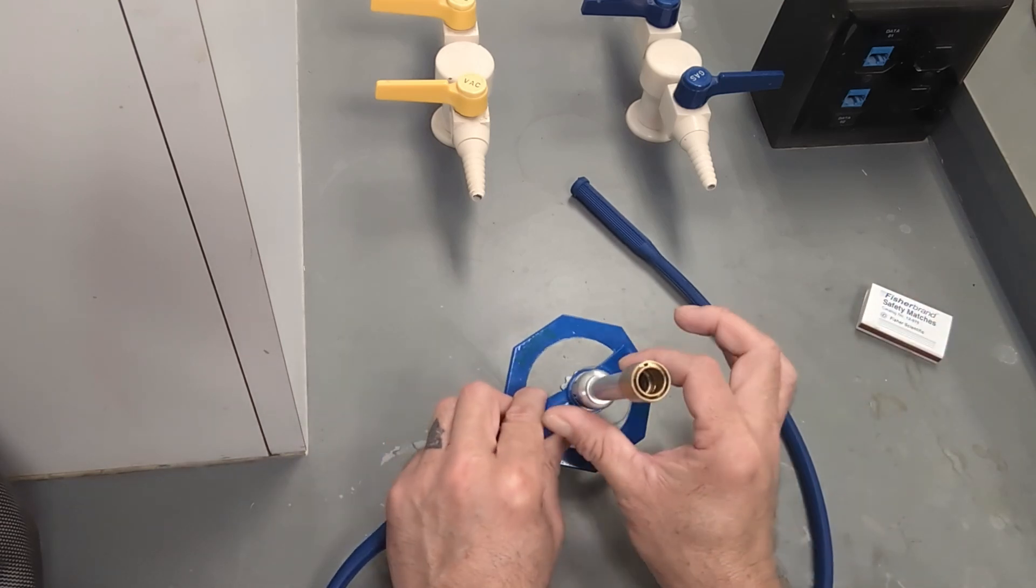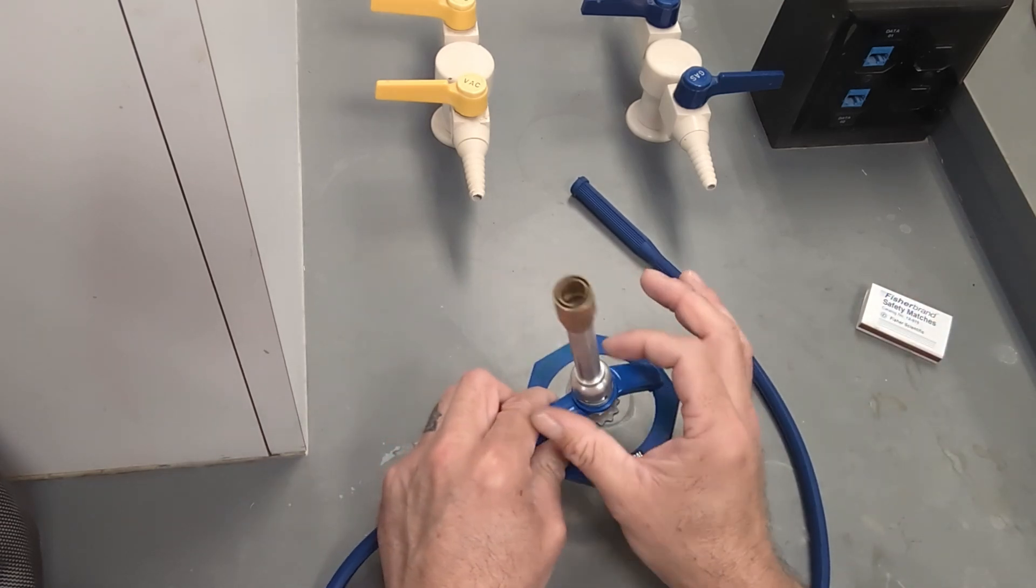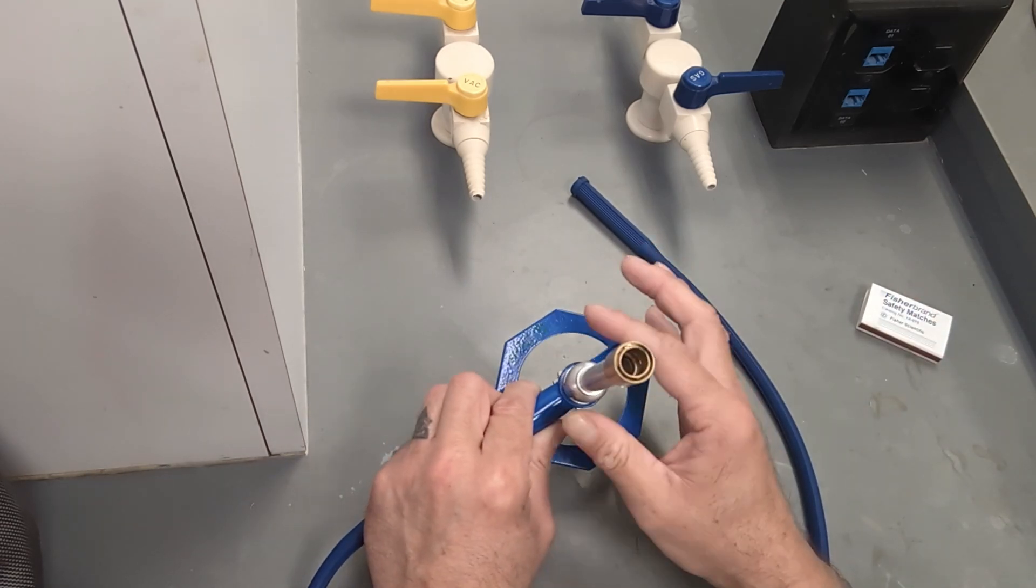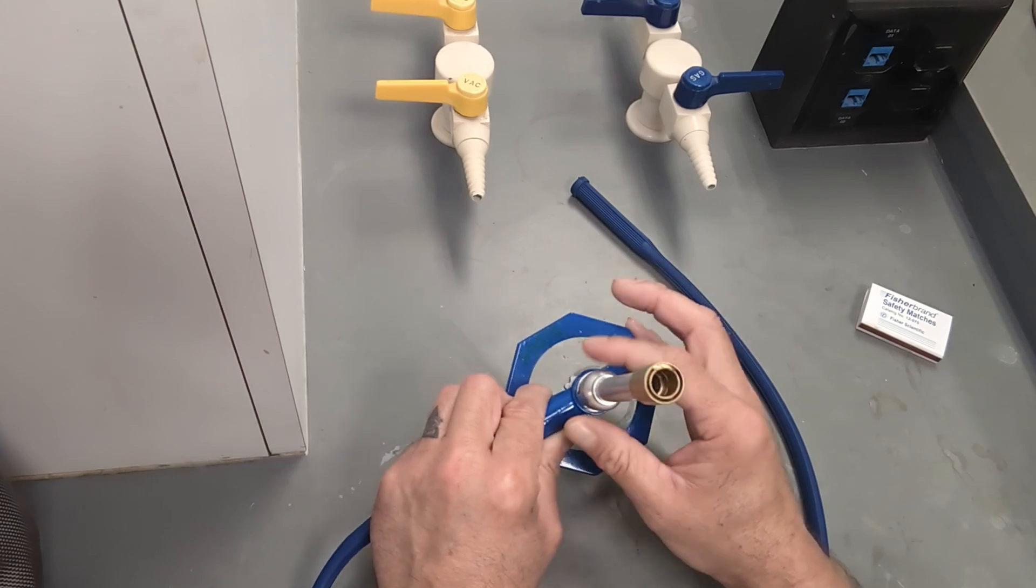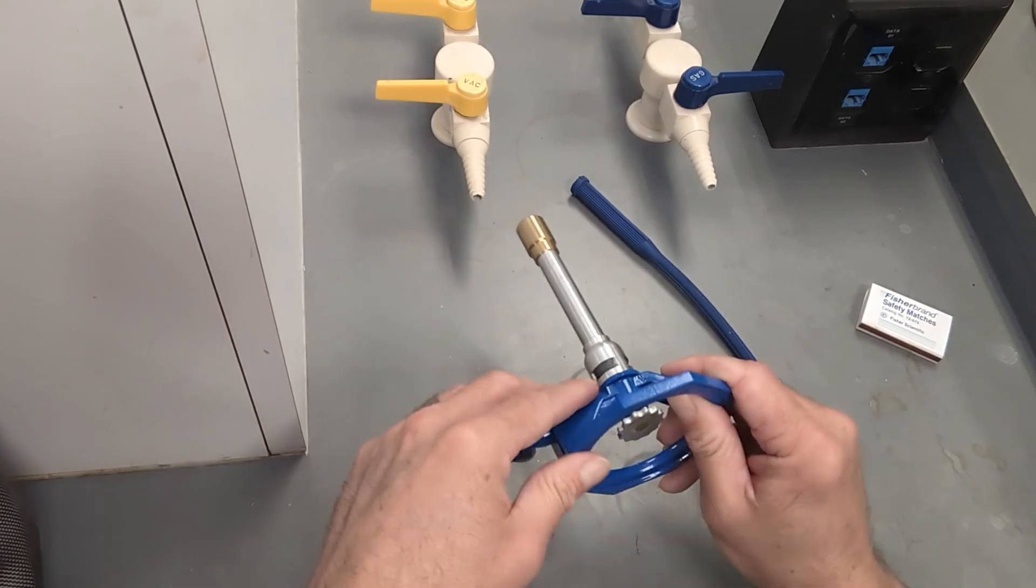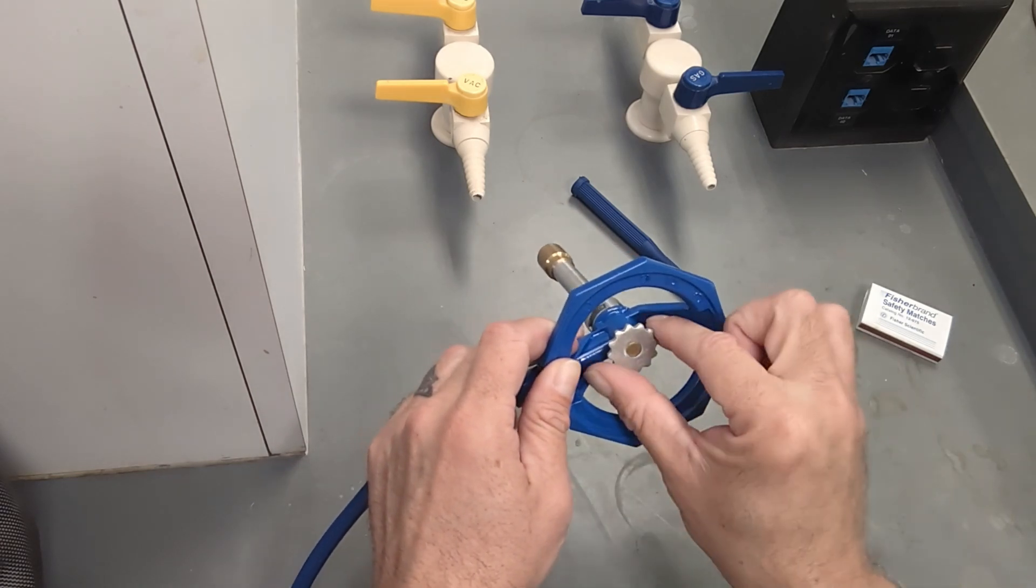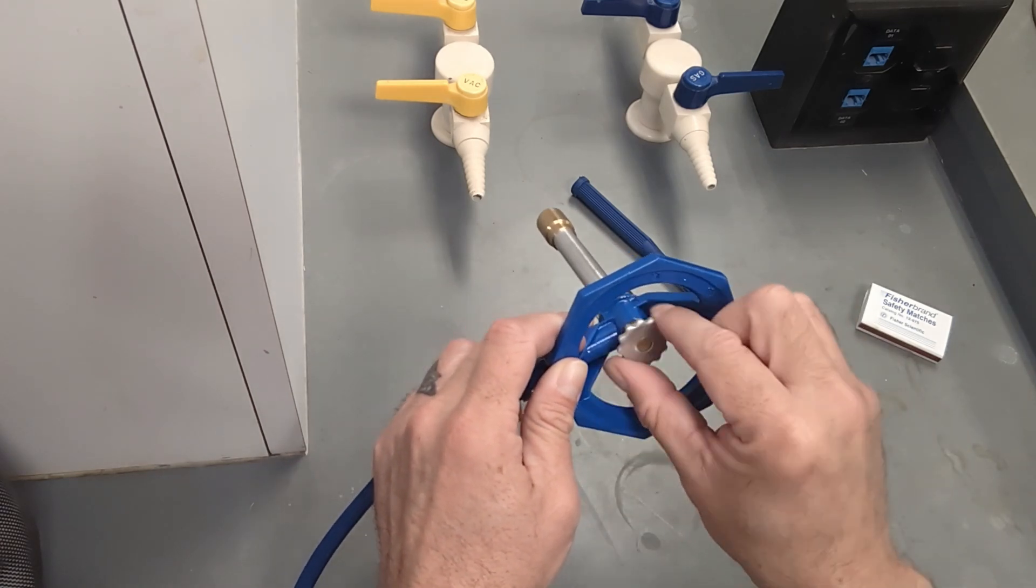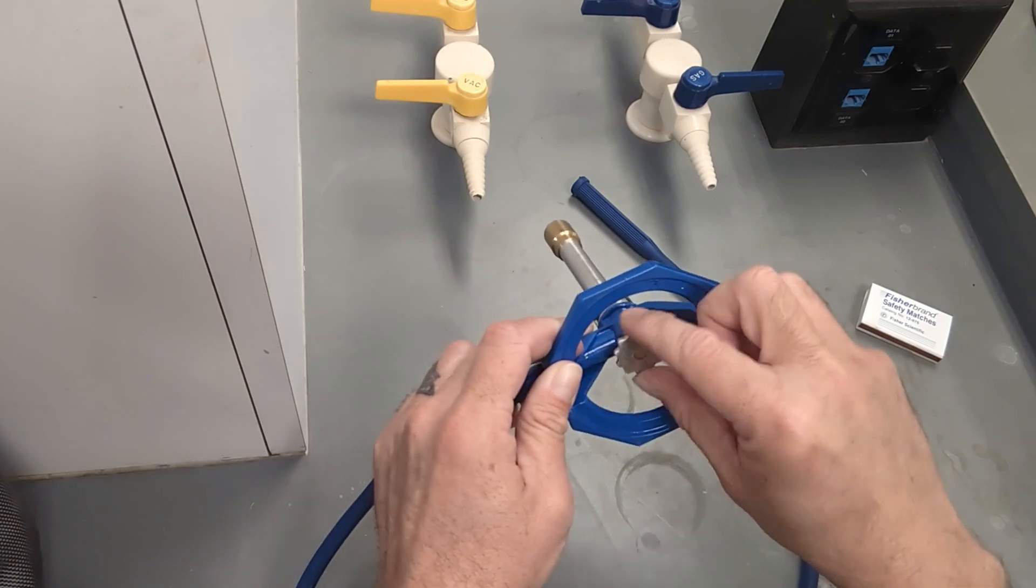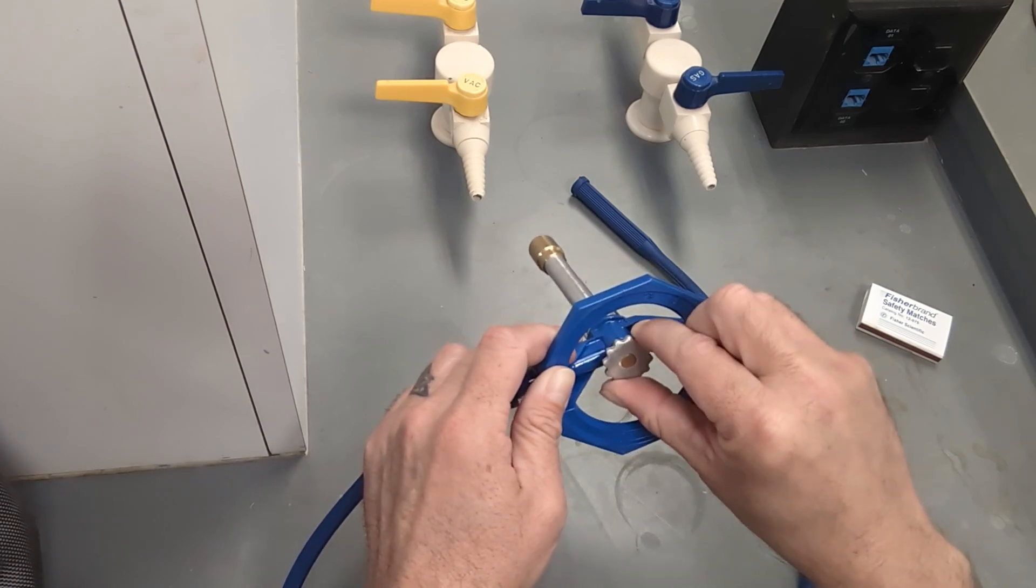Now what I like to do before using a Bunsen burner is close both the collar and the stopcock all the way, and loosening it just a bit. And if you'll notice the stopcock has a usual lefty loosey righty tighty if you're looking at it from the underside.